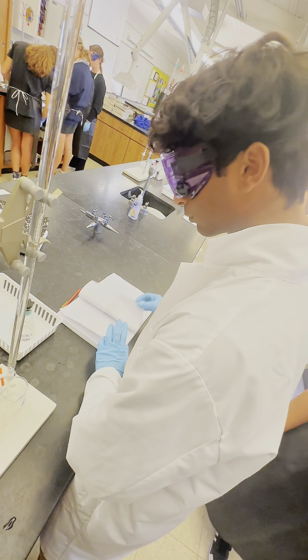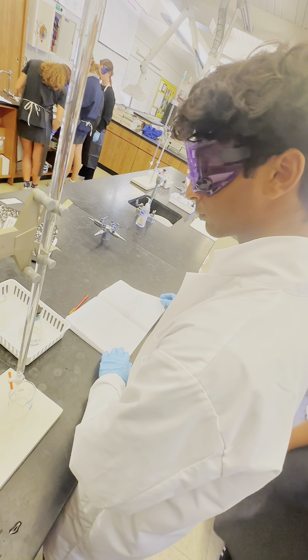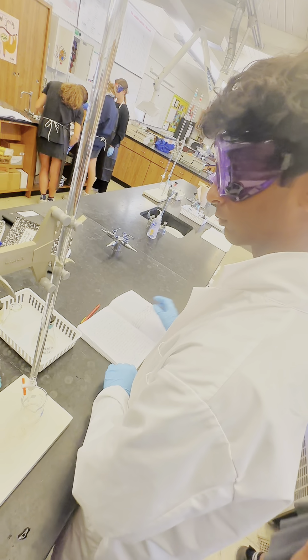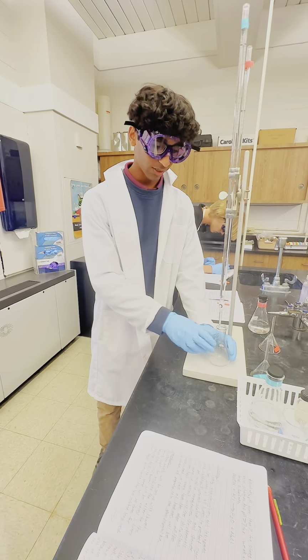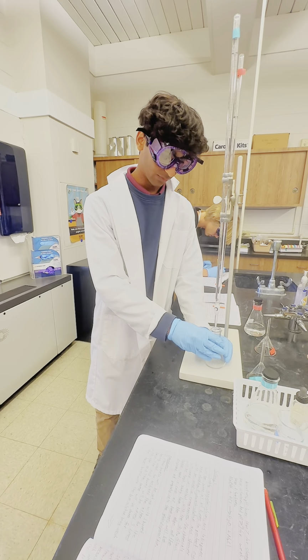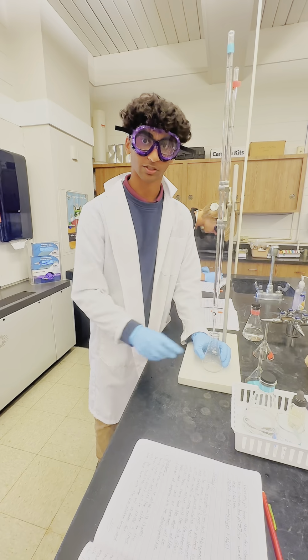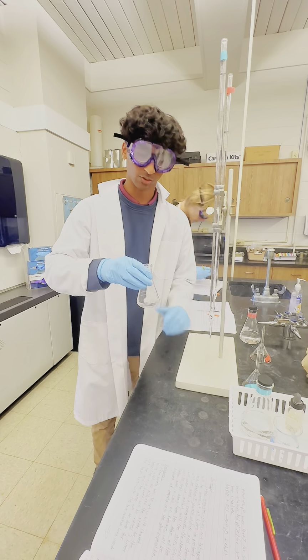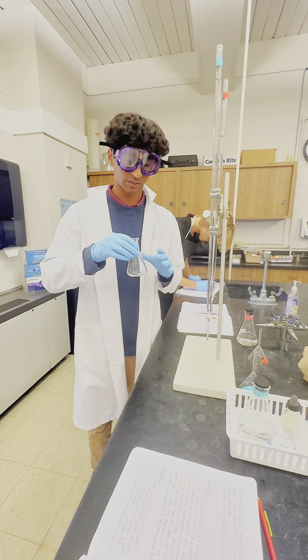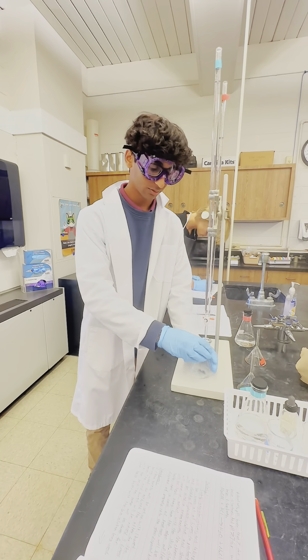Some acid was released from the burette to remove air bubbles. The initial volume was subtracted from the final reading. This was the exact volume of acid released into the flask, recorded to the nearest 0.01 milliliters. 3 drops of phenolphthalein were added to the flask. Some base was released from the burette to release air and lower the volume to the calibrated portion of the burette. The volume of the base was recorded to the nearest 0.01 milliliters as the initial volume.